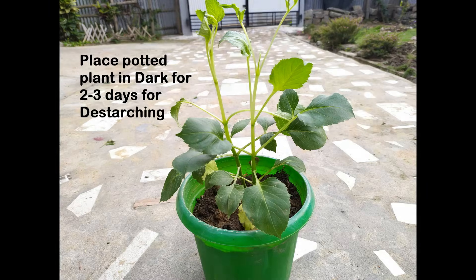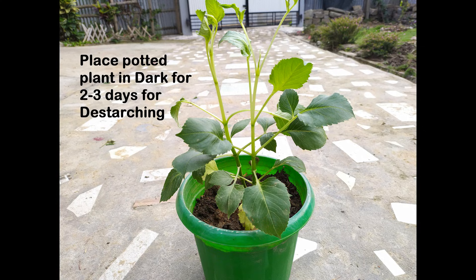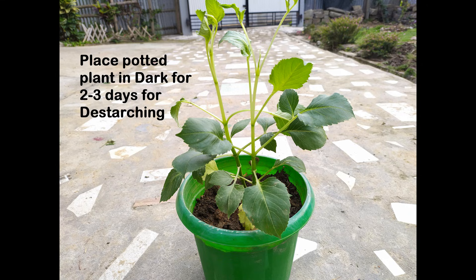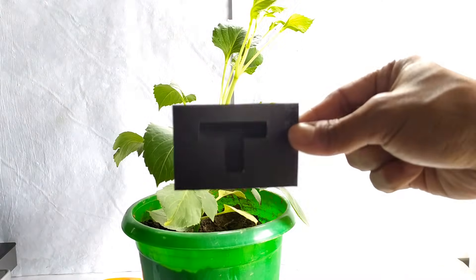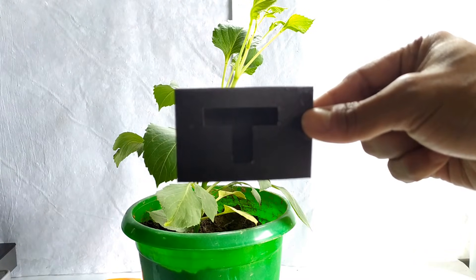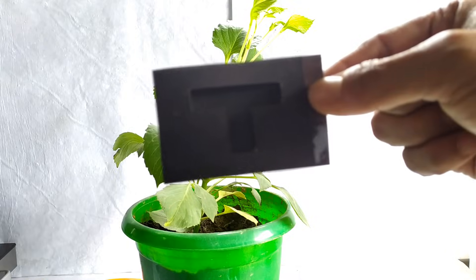Begin the experiment by placing the potted plant in the dark for about two to three days. This step is essential in order to rid the plant of any starch that was formed in the leaves prior to the start of the experiment. At the end of this time period, remove the potted plant from the dark. Cut a piece of black paper and secure the cut end of the paper using sticky tape.